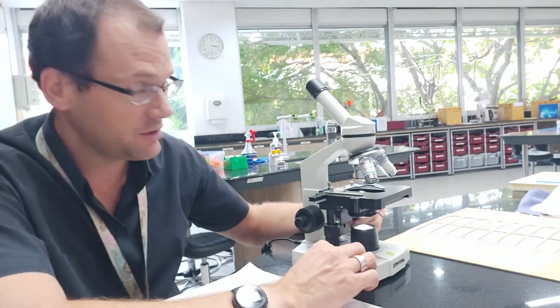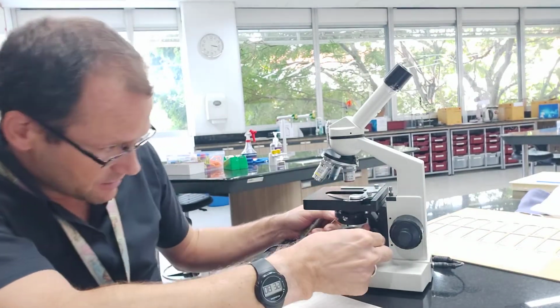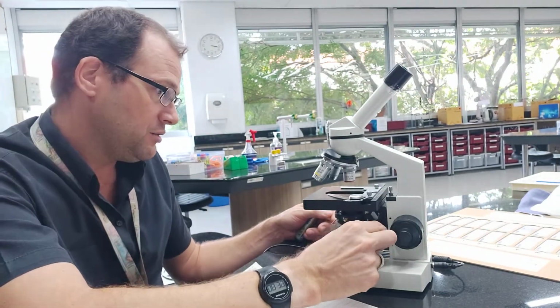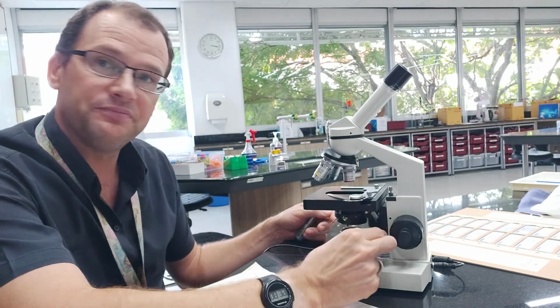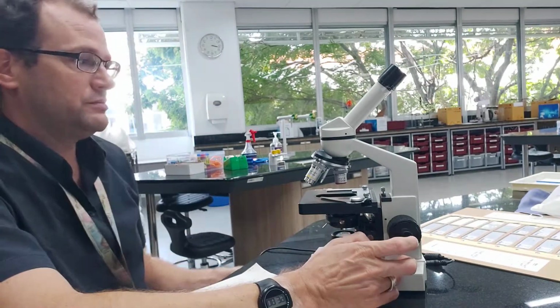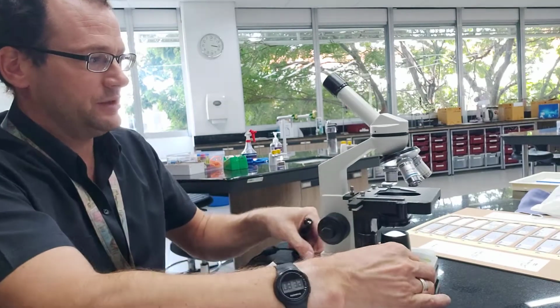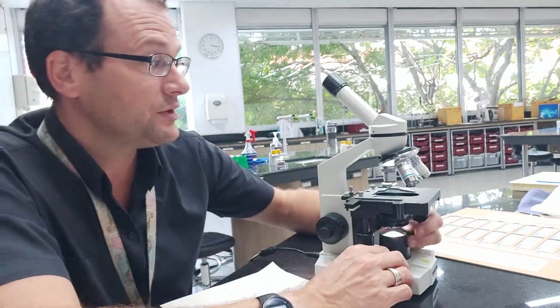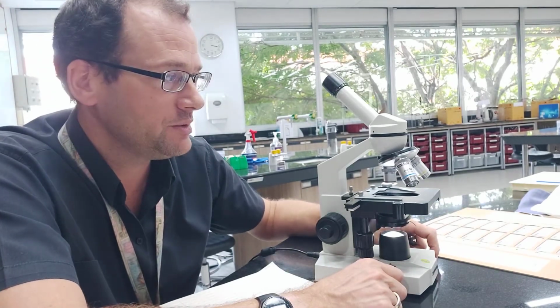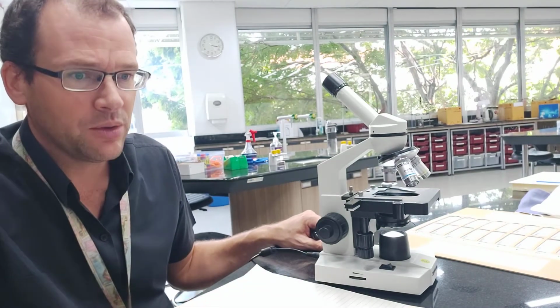And these particular microscopes, you can actually also, I'll turn it round, you can move the light focus up or down as well. But what we could do is just move it so that this is midway, and then move it also so that the light's gone off again. There it is. So you're sort of aperture half open. All right, so we've got not too much light, not too little, and we can go from there. So there's your light. Power on, light on.